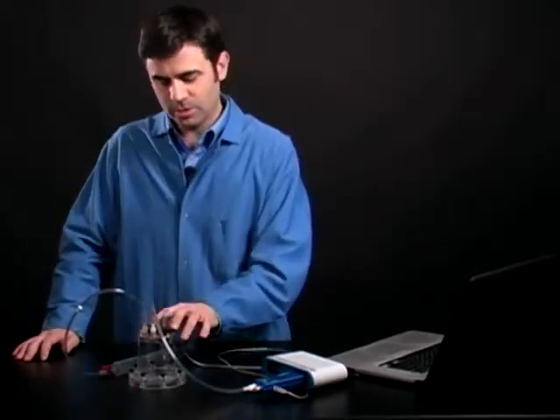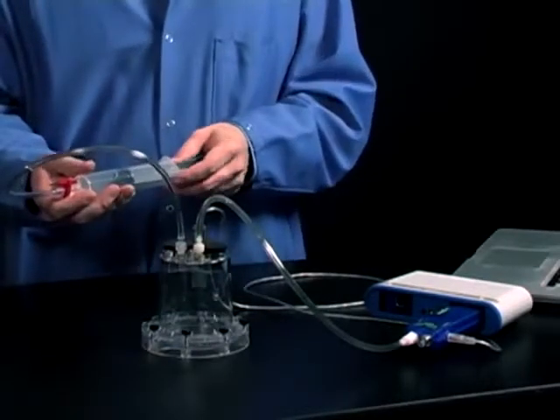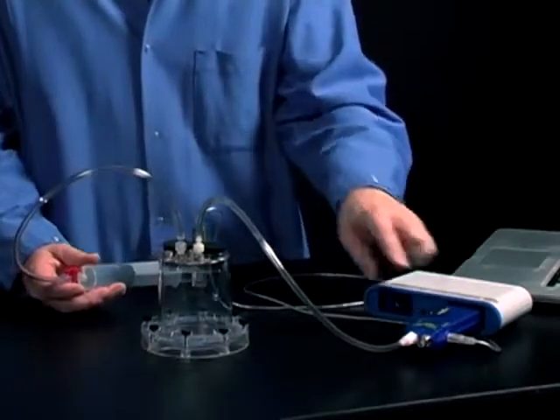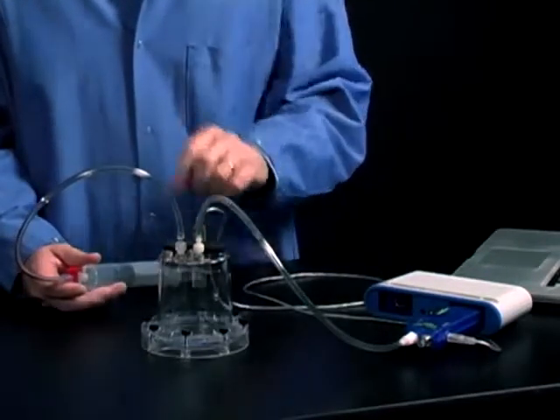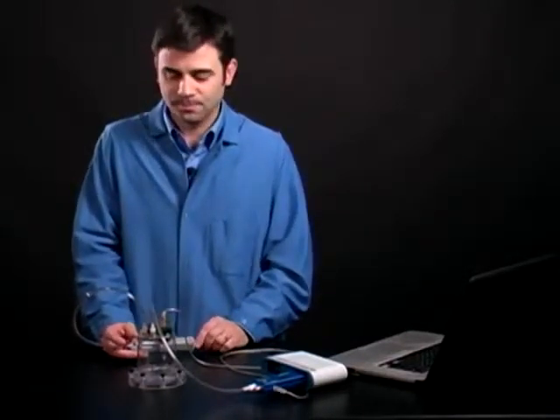So the atmospheric property chamber is a great way to study gases. I can use a syringe to change the volume of the gas or add different samples of gas. I can attach it to a chemistry sensor where I can measure the pressure and temperature. It also has additional ports where I can attach additional probes like pH, conductivity, and oxidation reduction potential.